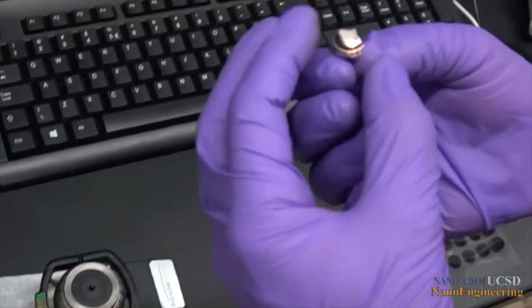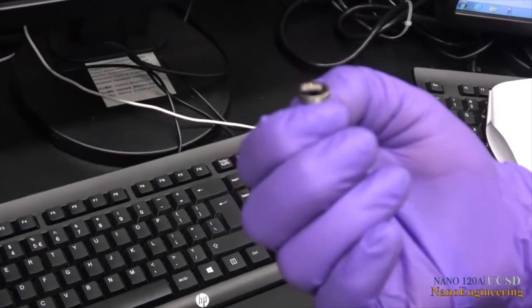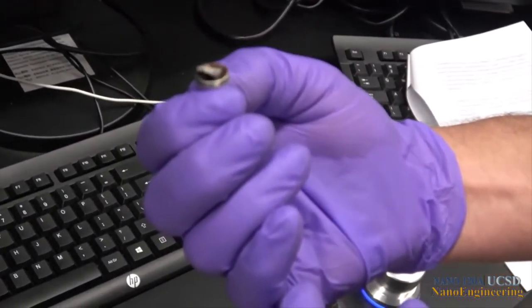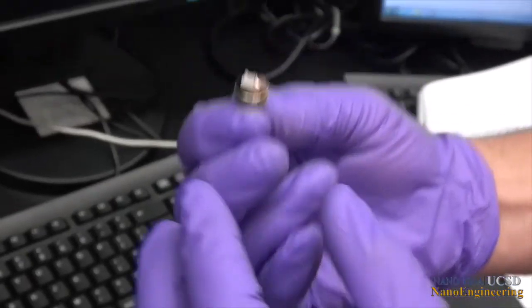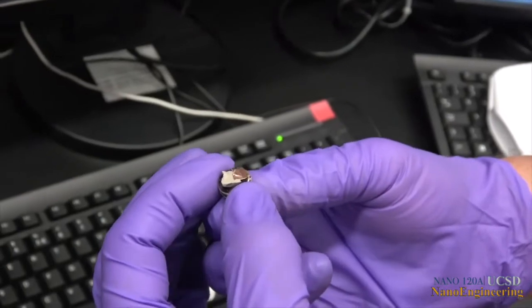For today's demonstration, we have a porous titanium oxide fracture surface as our sample. It is held to the aluminum specimen mount with a piece of sticky conductive carbon tape, shown here as the black material underneath the sample.